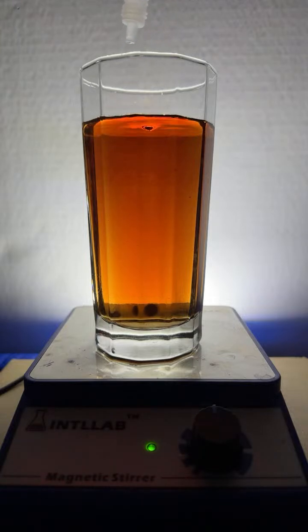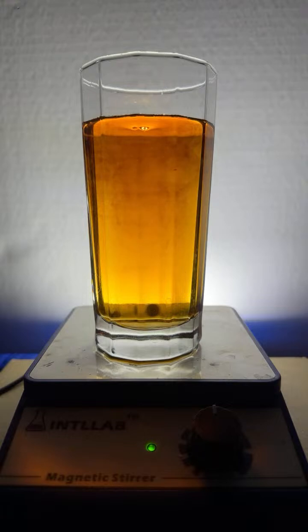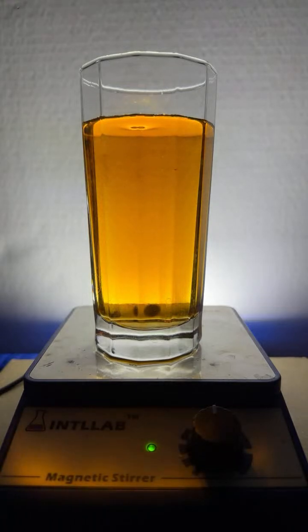I'm gonna have to clean all this stuff out. There's 5 drops. Yeah, look at that. Back to yellow. Back to yellow. It's a bit more, the sangria. Yeah, I agree. It's pretty. That looks nice. Yeah, the green was a little disappointing, to be honest with you. I didn't like that a whole lot.